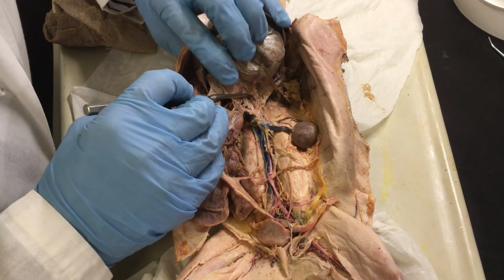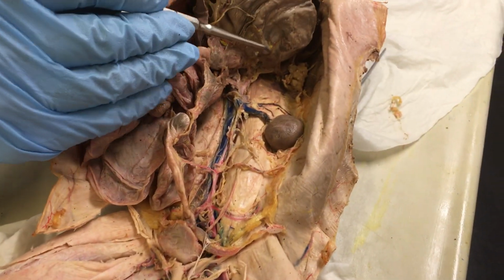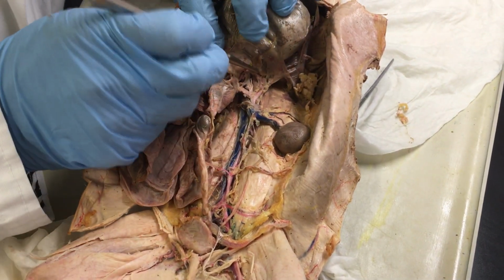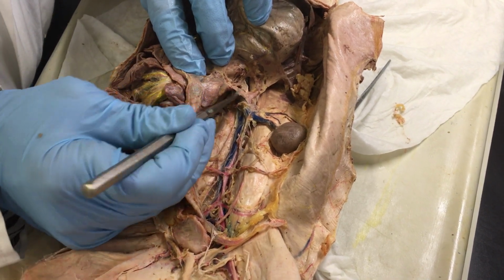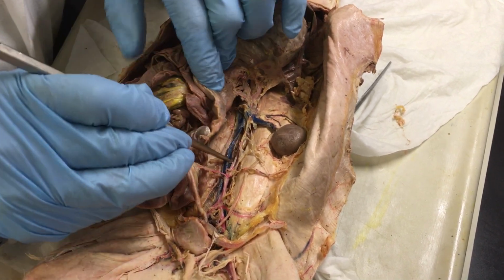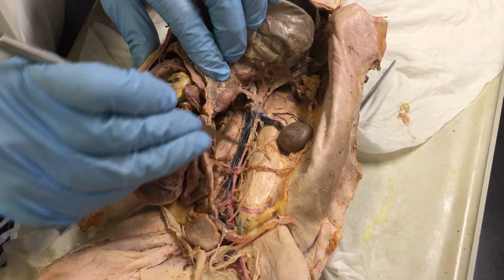So right here on top, I'm moving the stomach to the side, and so the aorta, from the left subclavian aorta that I showed you in the previous section from the heart, will go all the way to the back of the body, and then there will be different branching, but the one that I want you to notice is this one here. So the aorta will continue all the way down. I'm going to show you all the way, along the spine. This is all the aorta, right?